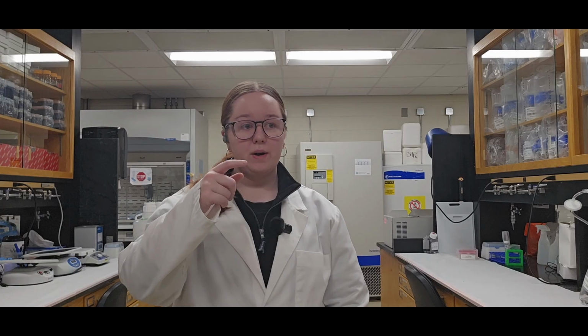Now, I prefer to do a cell count with the cell suspension before it enters the centrifuge during passaging, so that while the cells are spinning down, I can do a cell count, and then hopefully once I'm done doing the cell count, my cells are done spinning down, ready to be resuspended in fresh media and split into the flasks or well plates that they're planning on going in.